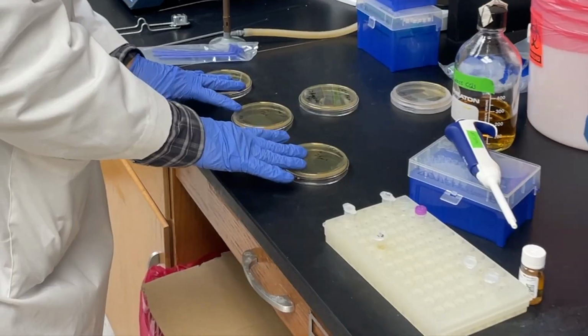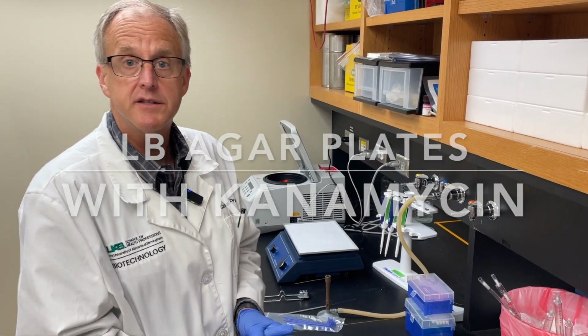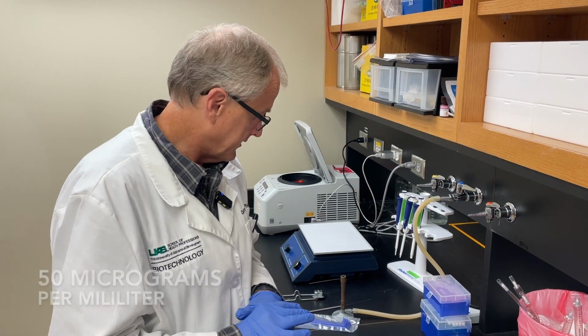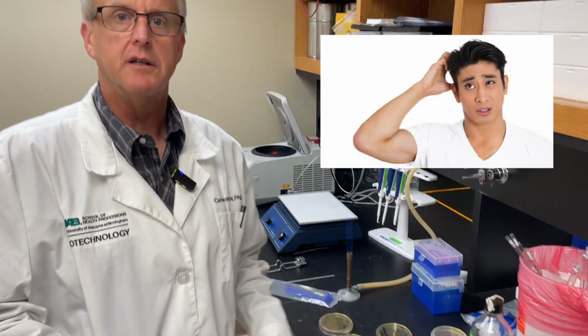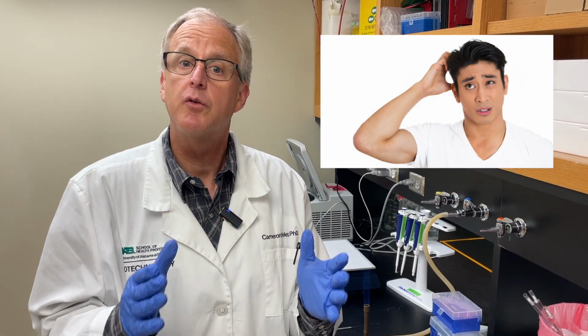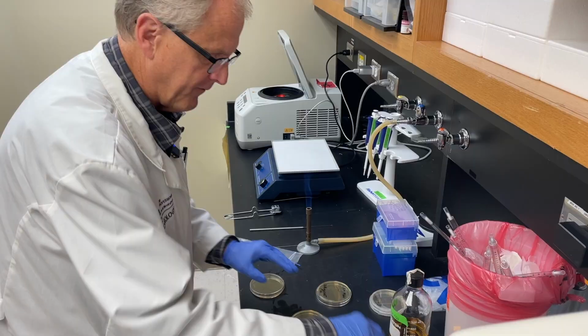I've got plates set up here. Control. These plates are LB agar plates with kanamycin at 50 micrograms per milliliter. That's the concentration. And you're going to say, why do you have kanamycin? Again, we're trying to select for any bacteria that have incorporated the plasmid. Fresh spreaders. Grab one, and I'm just going to add 50 microliters.